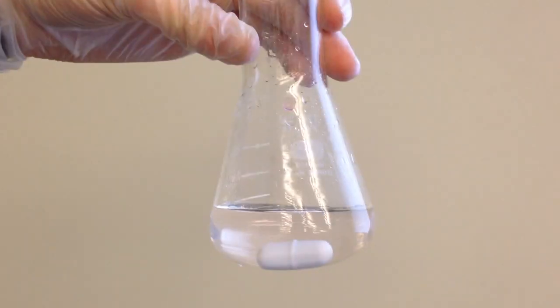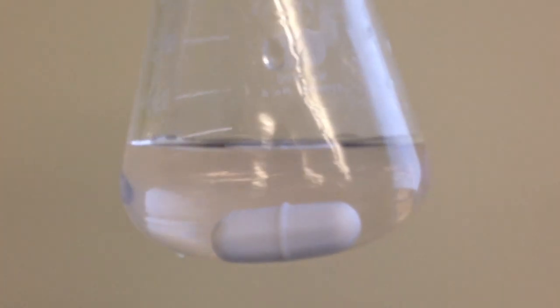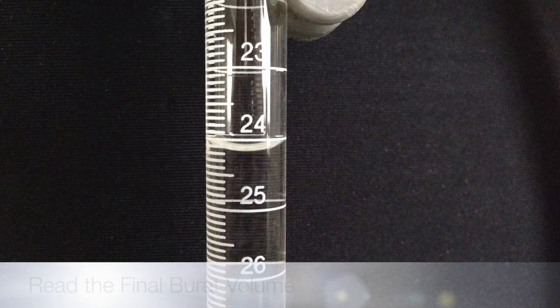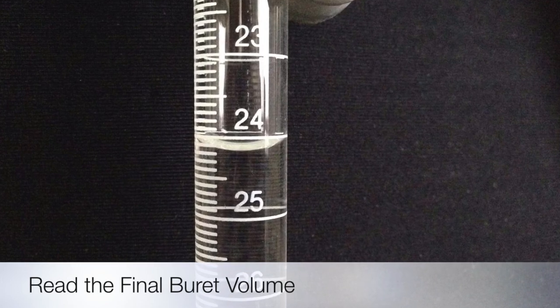Once your titration has reached the endpoint, your sample should become clear again. Read the final burette volume to determine how much titrant you used.